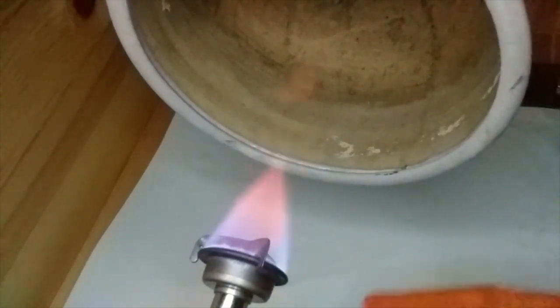I'm not going to put that in for longer because I don't want to hurt myself or mess up the stove because I know there might be a little bit of sulfuric acid inside of that. Let's do it.